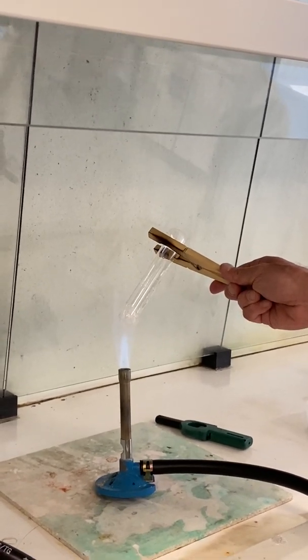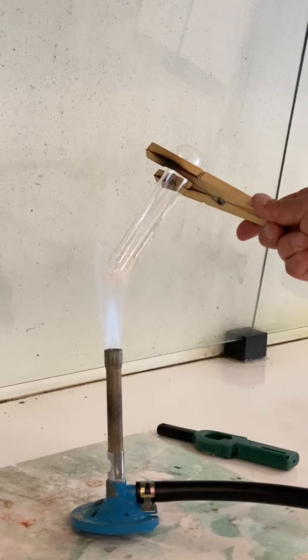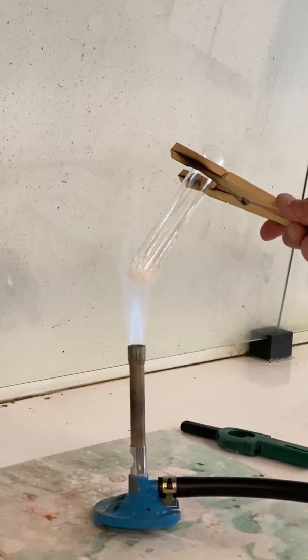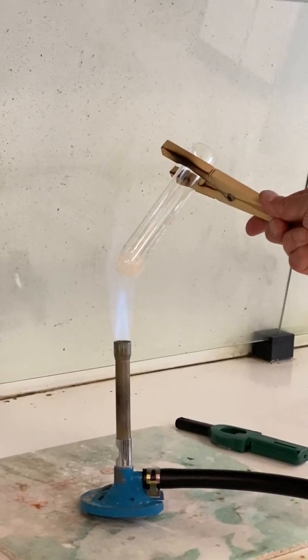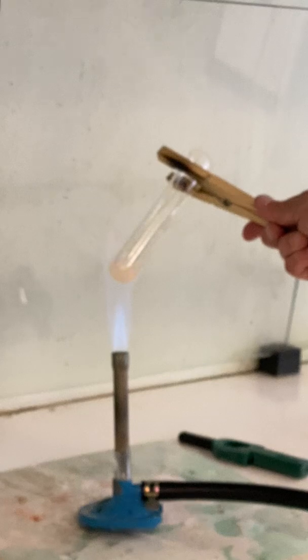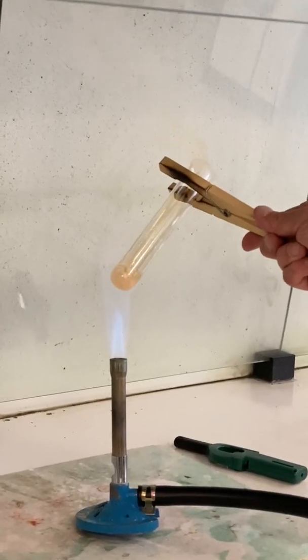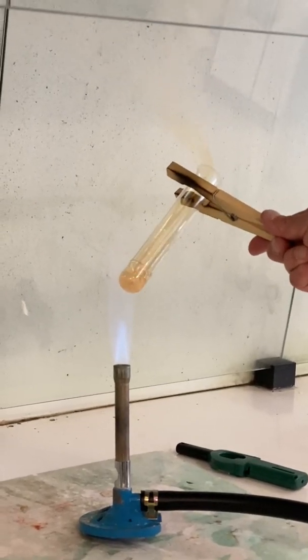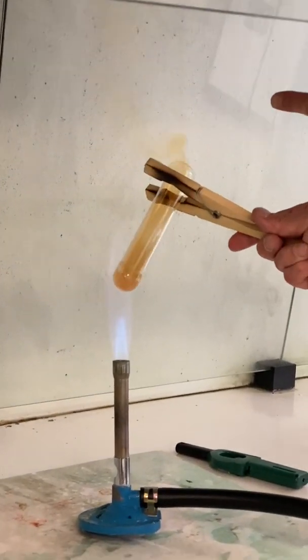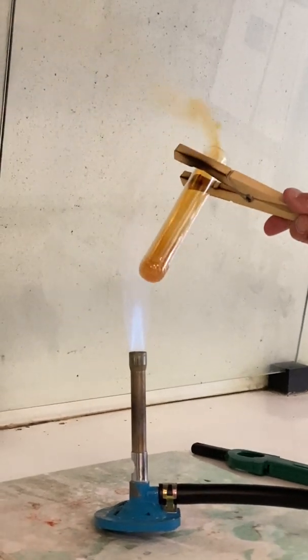I'm right in saying that we're beginning to see that now. Yes — there you can see the brown smoke.